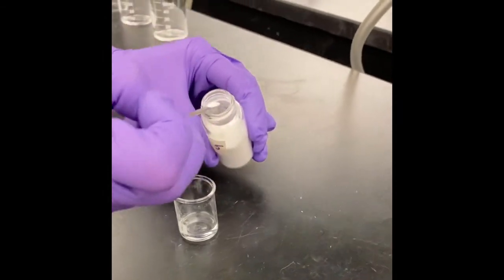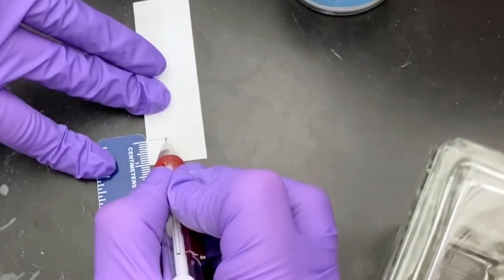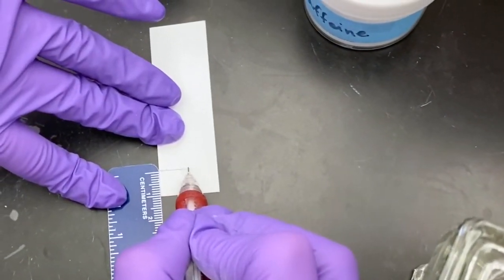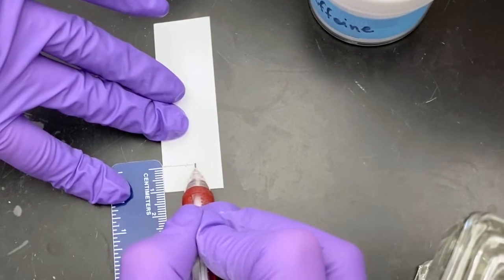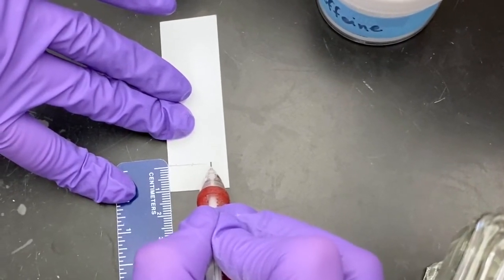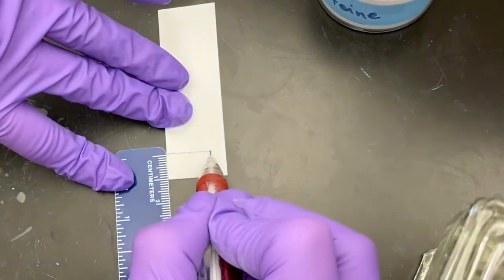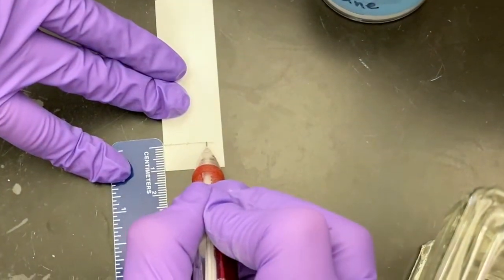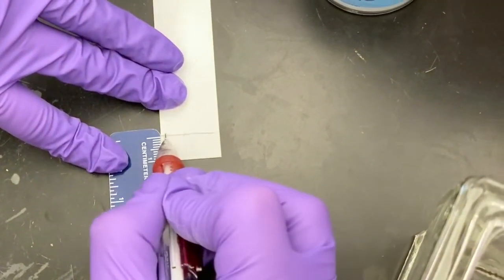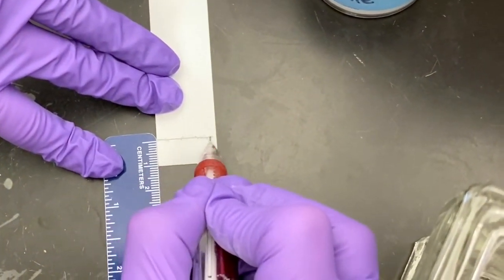Once these solutions have dissolved, set up your thin layer chromatography by retrieving a TLC plate. About a centimeter from the bottom, sketch in pencil a line representing the baseline. The baseline will give you a starting point for your solutions that will assist you later in calculating your retention factor.